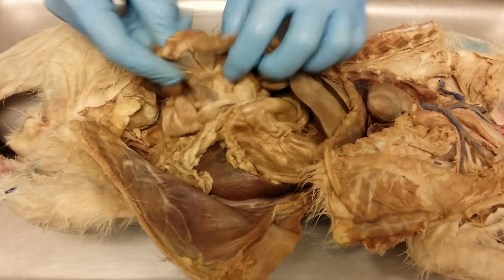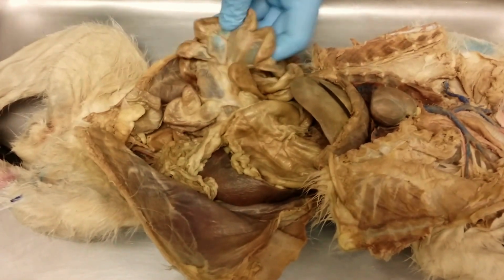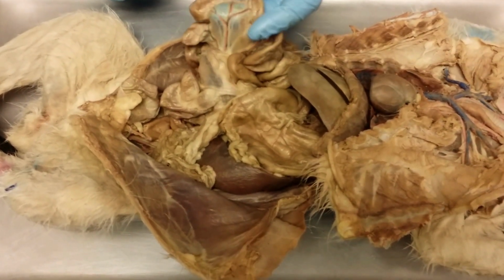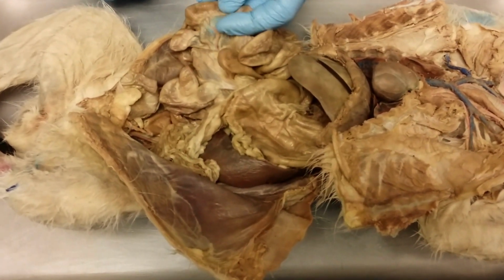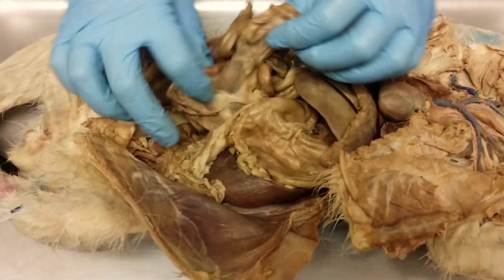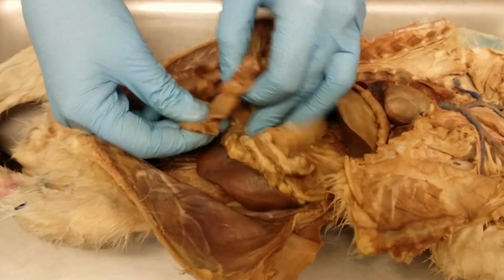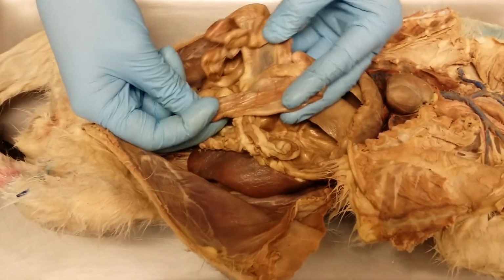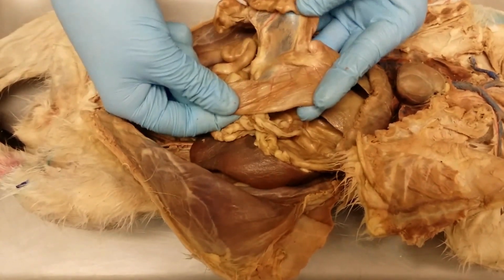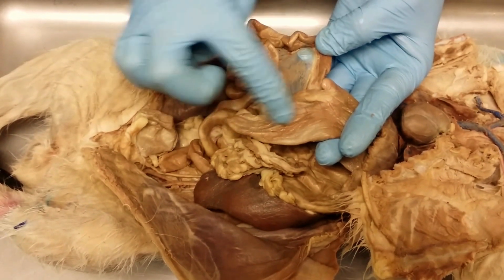If I ask small intestine, but it's somewhere in the middle, not close to the stomach, not close to the large intestine, what would you say? What's the middle part of the small intestine? Jejunum. Okay, so jejunum. Follow this around. You'll see an area right here. Do you see how there's a size discrepancy between this part of the intestine and this part of the intestine? This is the small, this is the large.